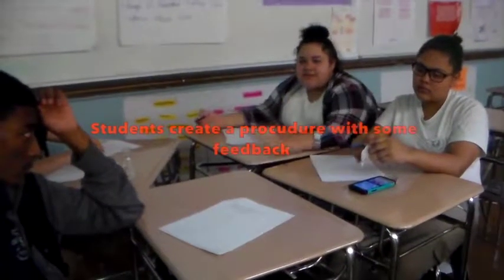So Jasmina, why did you change your hypothesis? Can you explain it for the camera? So I changed the hypothesis to refine it, to make it better, so I can prove it in the end of the experiment. And how did you refine it? What new information let you refine it? I included the indicator, and I say the concentration of base is known and the concentration of acid is unknown. But when does the indicator show?